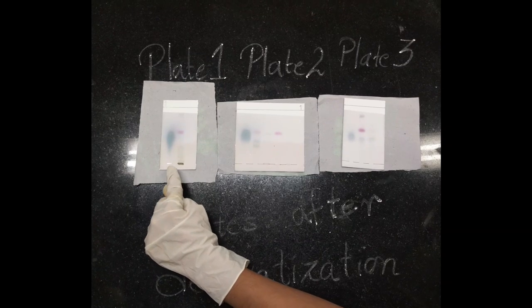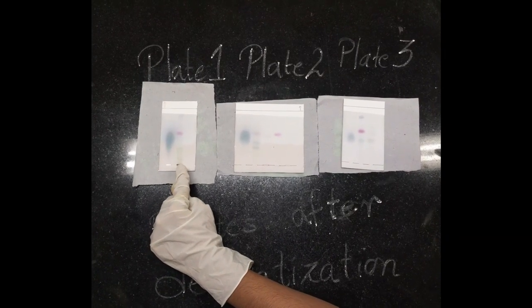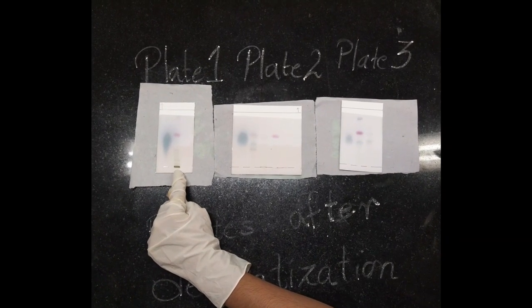This is plate 1. First is the standard spotted, second is the sample which is mint leaves.